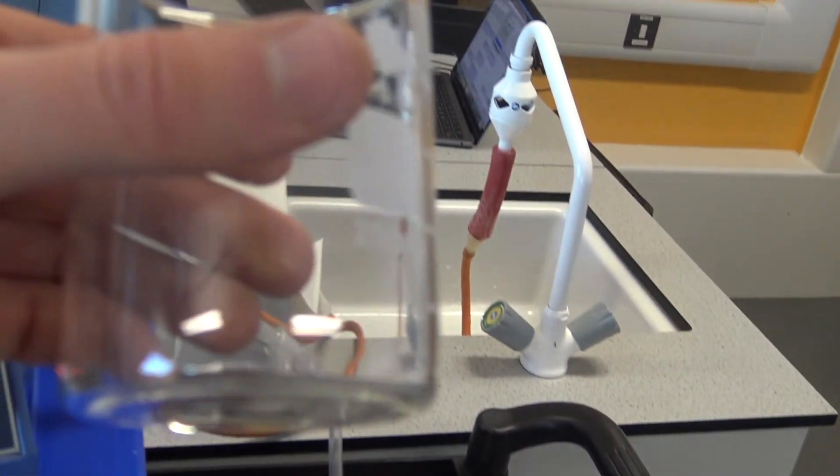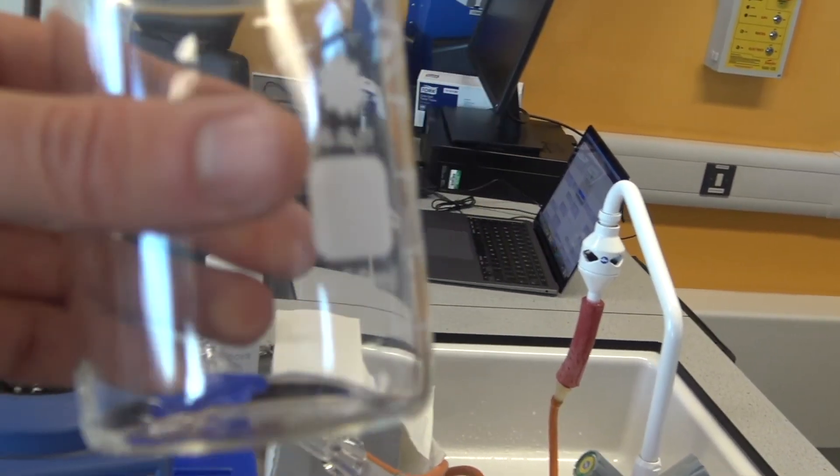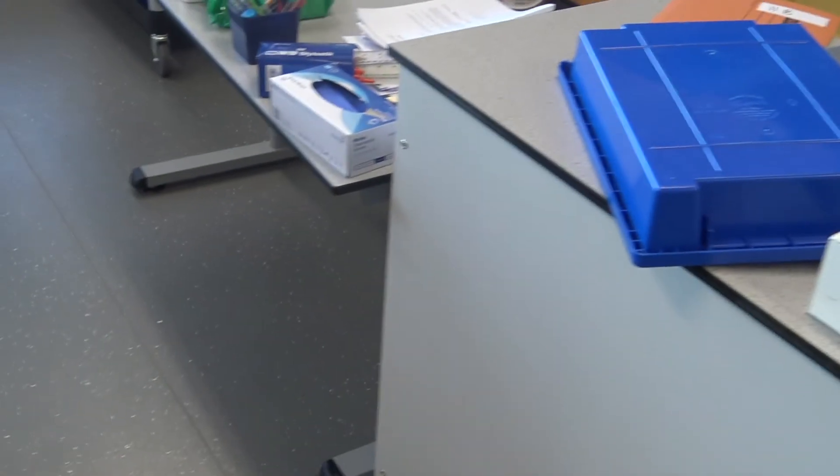Yeah, lovely! Some pure water has been formed from this disgusting black mixture of ink and water. We have formed pure water.